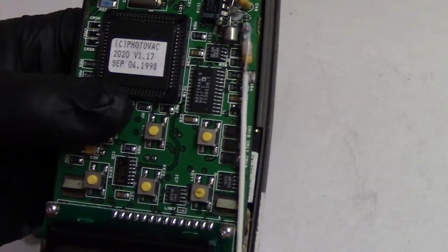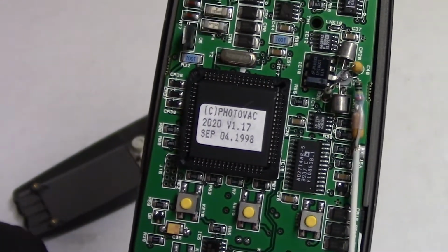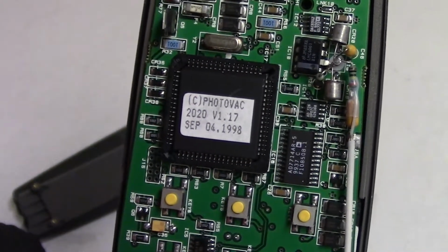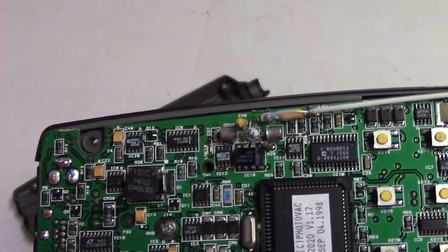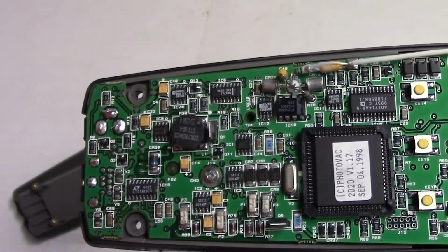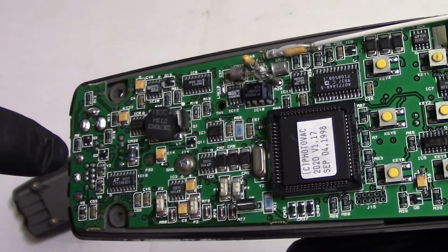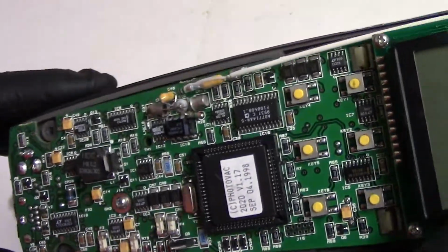There's the ROM with the software, PhotoVac 2020 version 1.17, September 4th, 1998. So that makes this particular device 24 years old. And the electronics are pretty good for 1998. I know we had surface mount back then. It wasn't super uncommon, but some of the parts definitely are higher end, like that capacitor there, for instance.